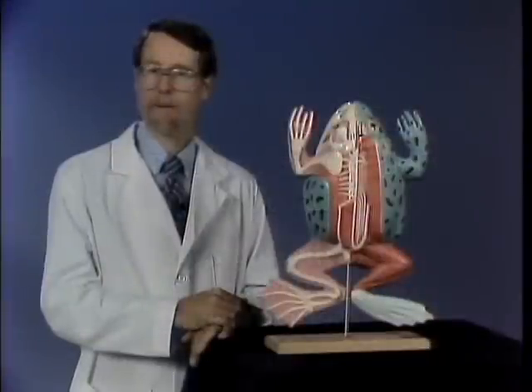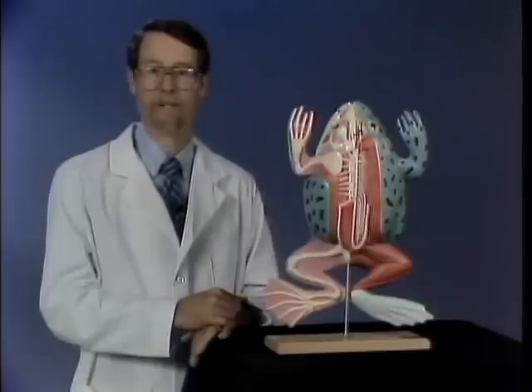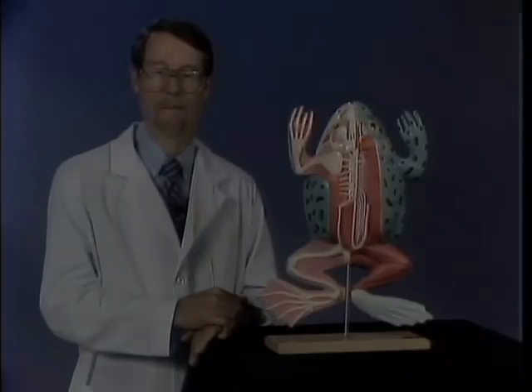In Section 3, we will examine major skeletal muscles of the frog. As discussed in Section 1, we will use zoological terms descriptive of body planes and directions. In addition, the muscle names will adhere to standard zoological convention for amphibians. This avoids the common mistake of applying mammalian names to some of the muscles, which are not the same ones in frogs.